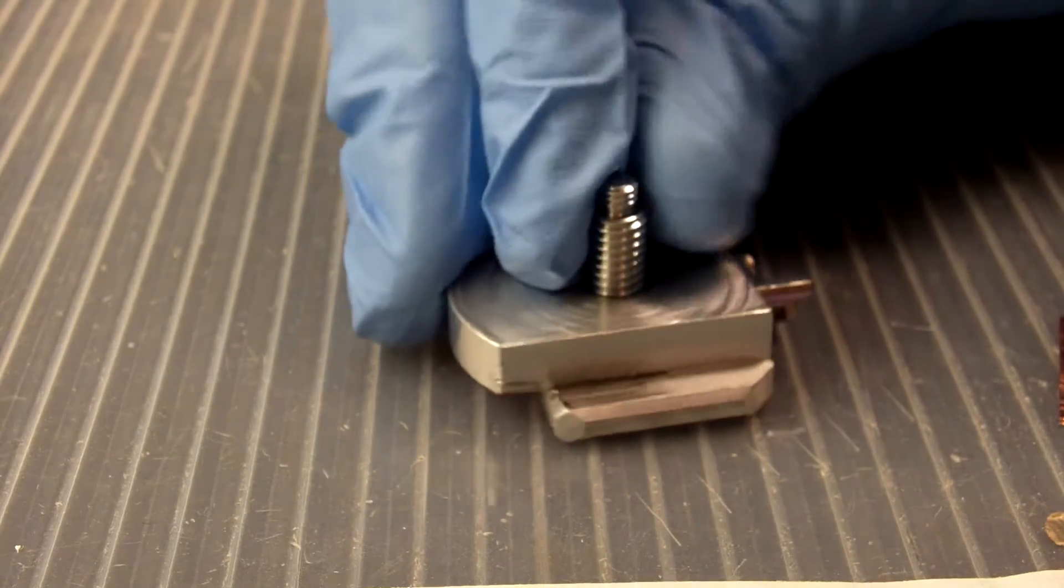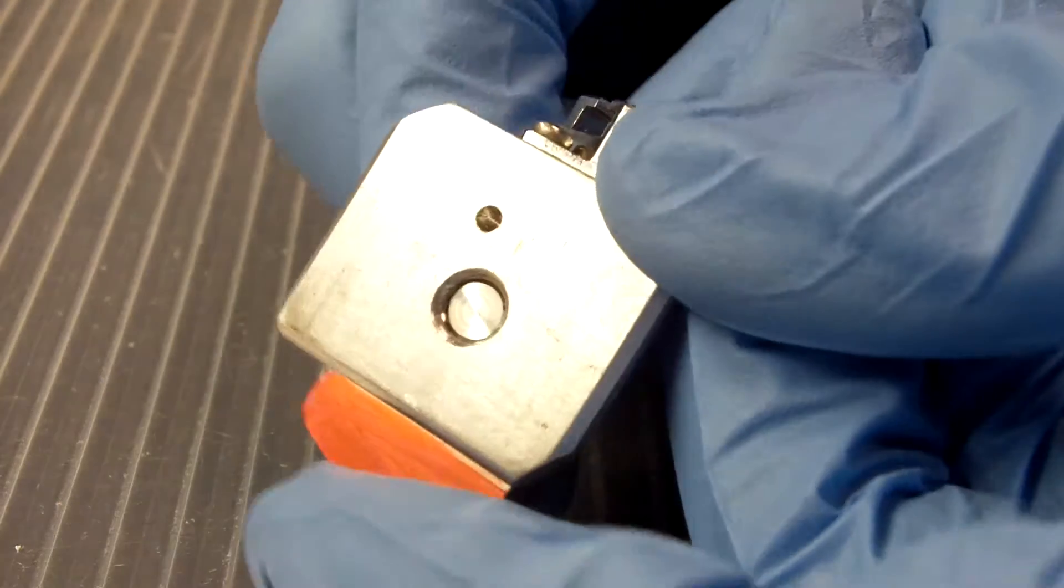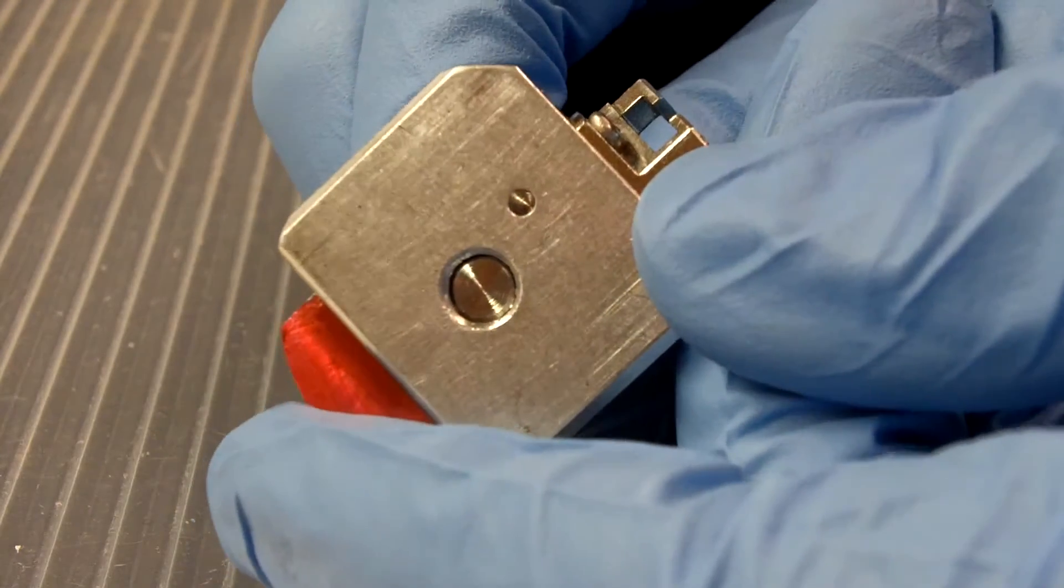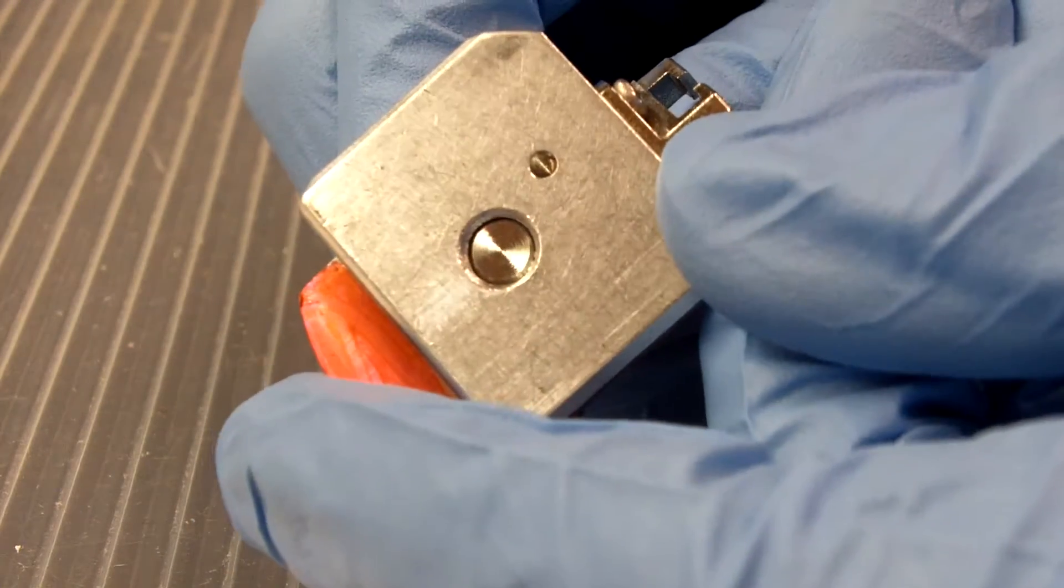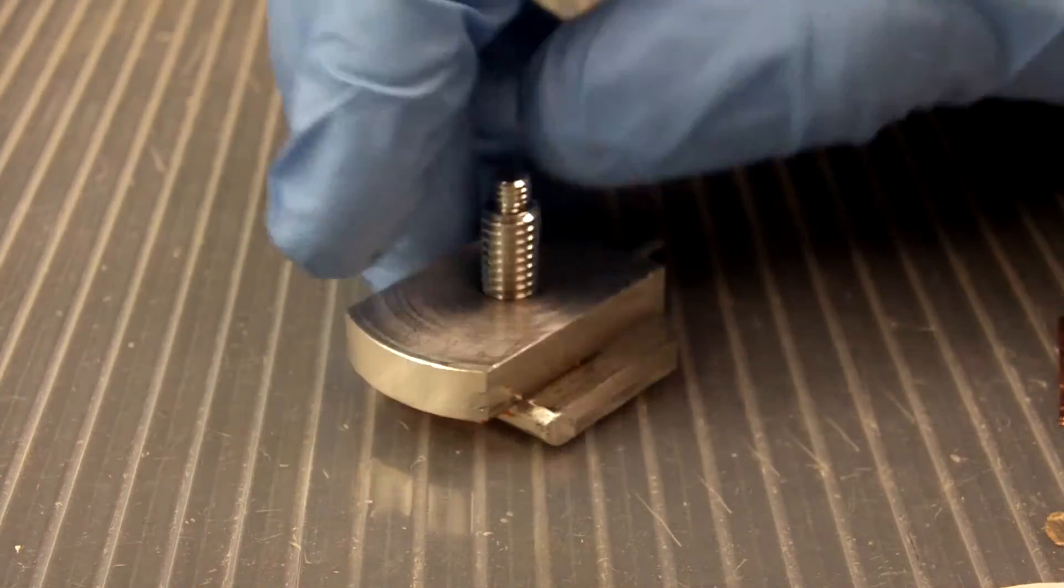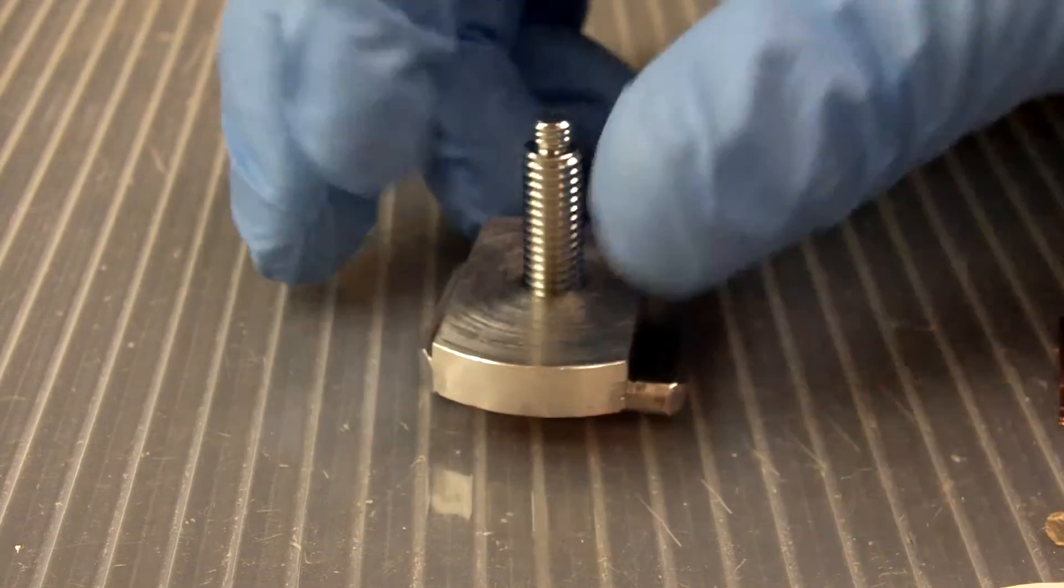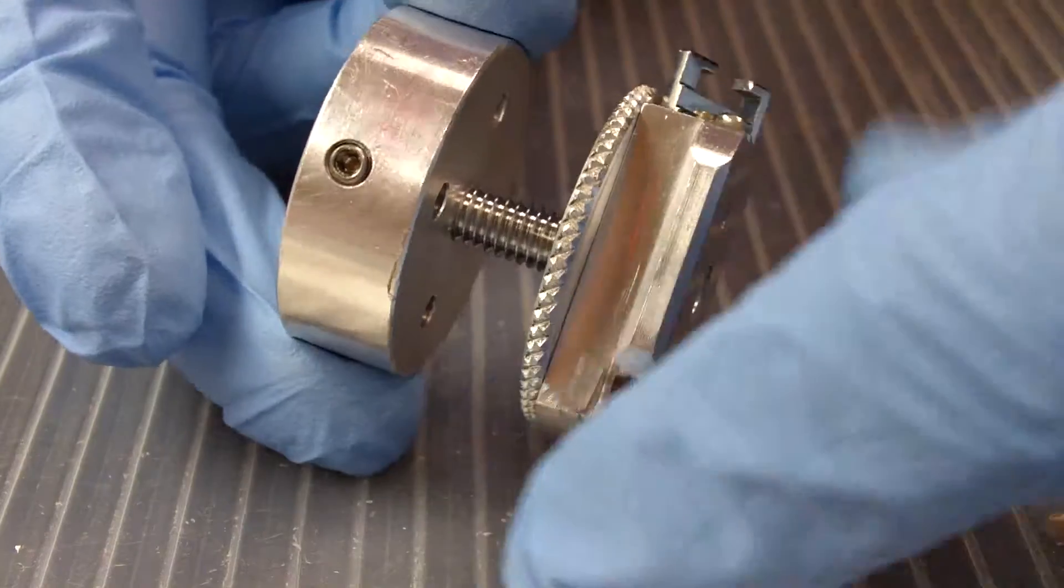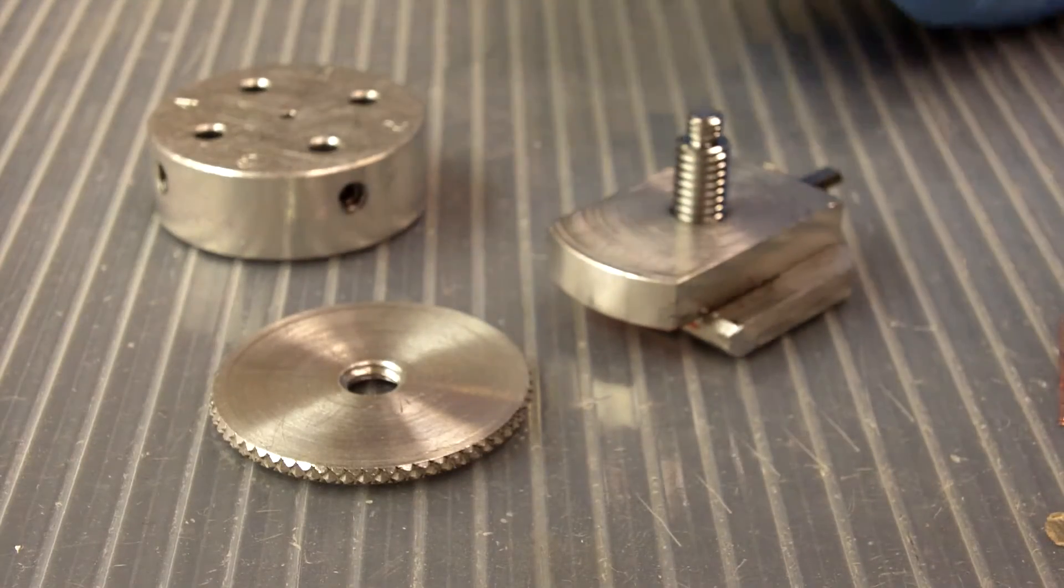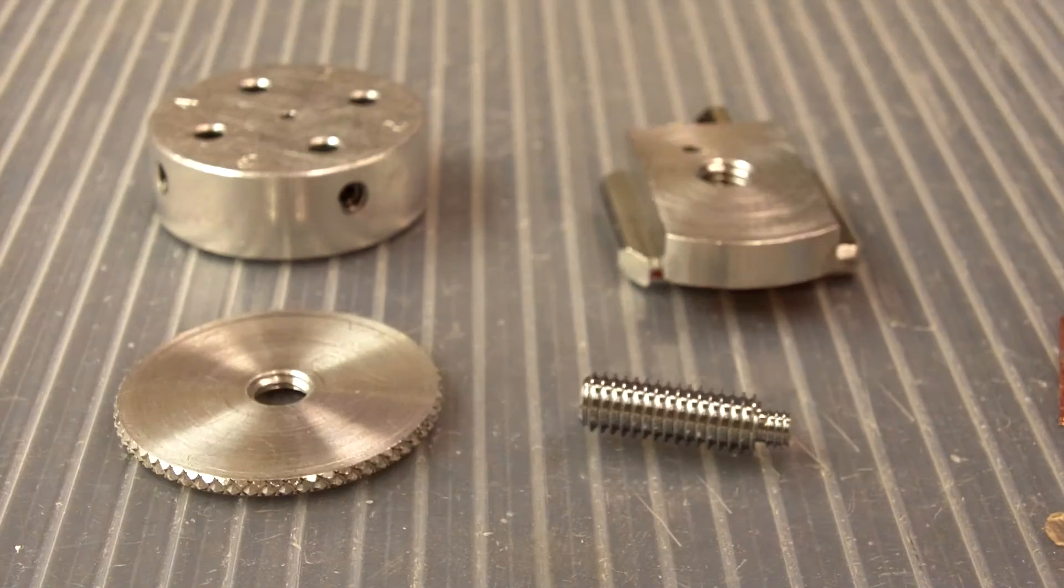Unfortunately, it has introduced now one new problem. And if you're not paying attention, you can jam the screw into the bottom of this base and then get it really, really stuck. We do not want that ever. It is never necessary for any two parts on this sample holder to be stuck together and unable to be taken apart with your bare hands. So if we put the four parts together, and then when you take it apart you only have three parts, it means you did something wrong. So let's start off by seeing how to do it the correct way first.